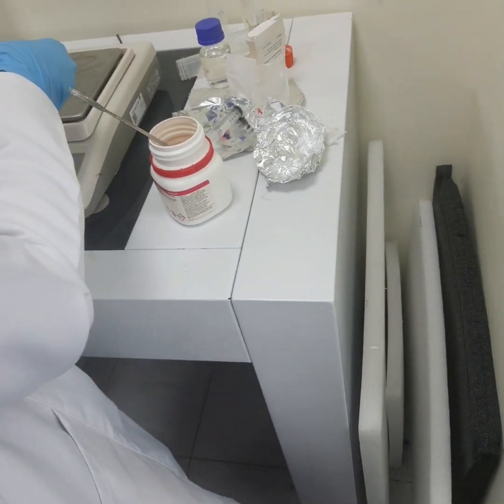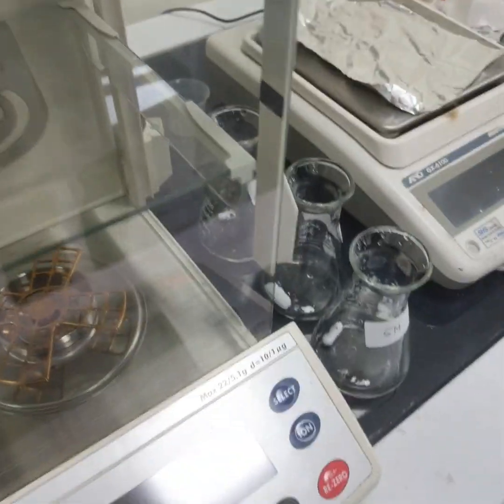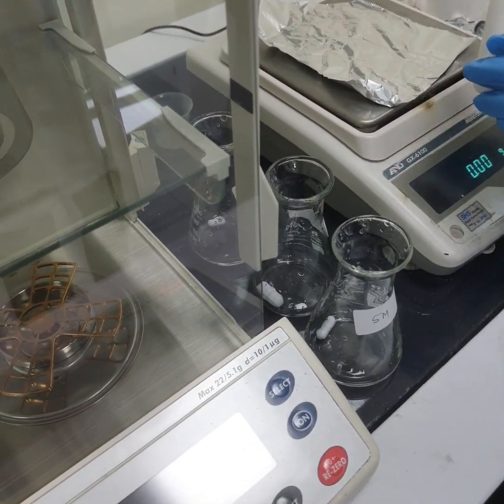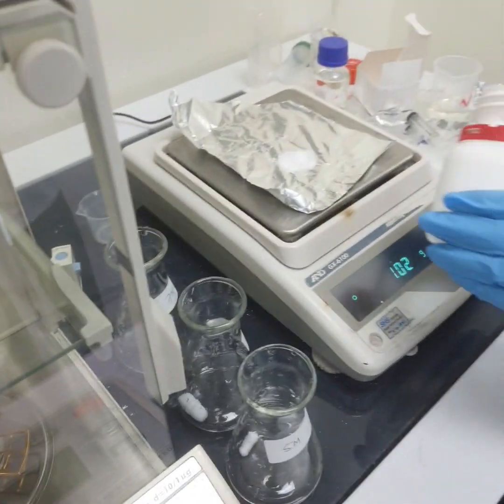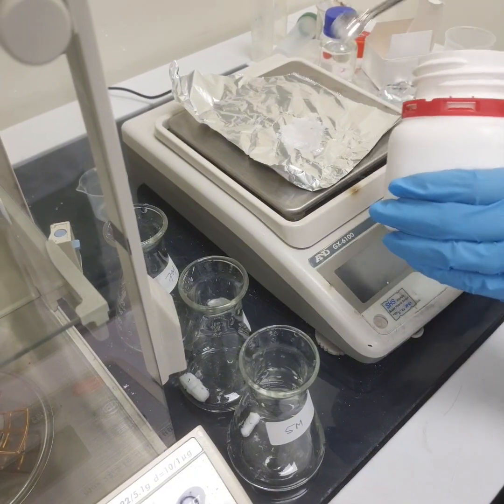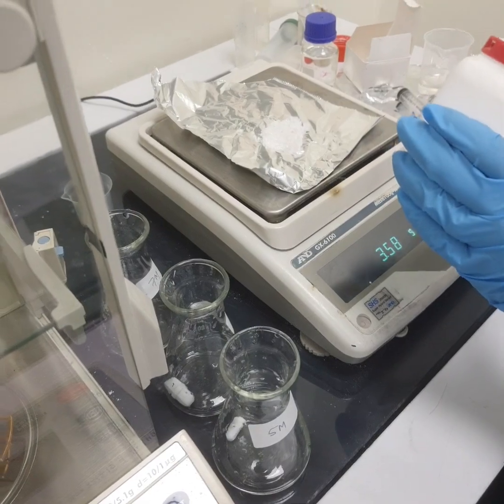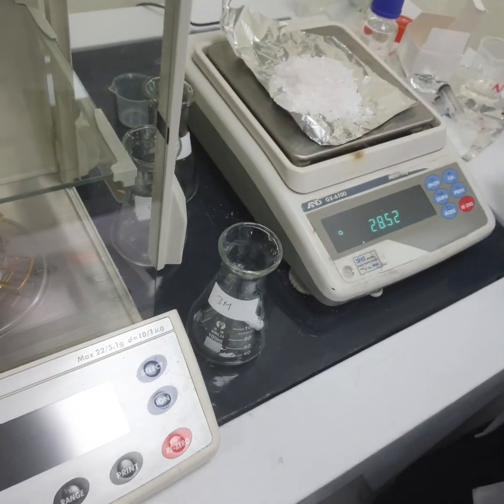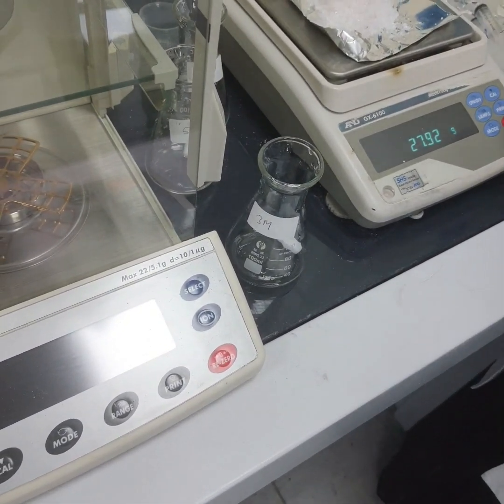So can you transfer? Now try to add on this aluminum foil. First of all tare and then add. Since weighing on the paper is difficult and the amount is too much, keep adding slowly. This is too much. Can you make it 28.23? Remove some, a pinch. Yes, remove.